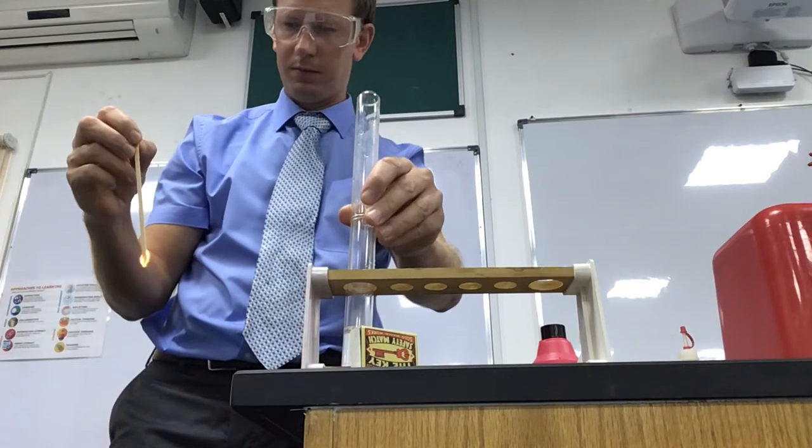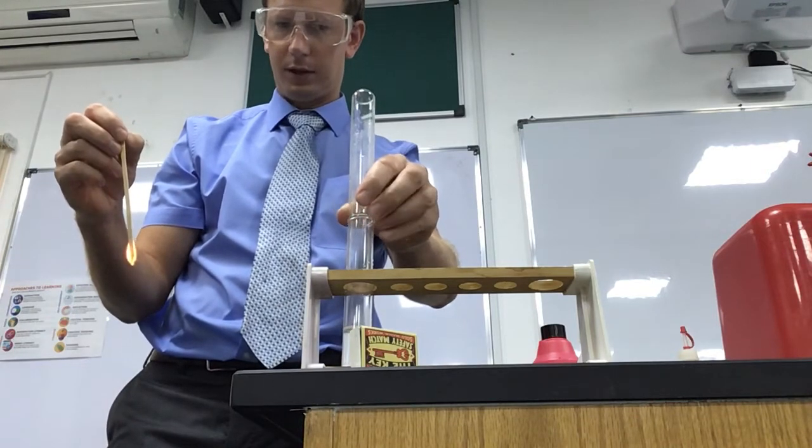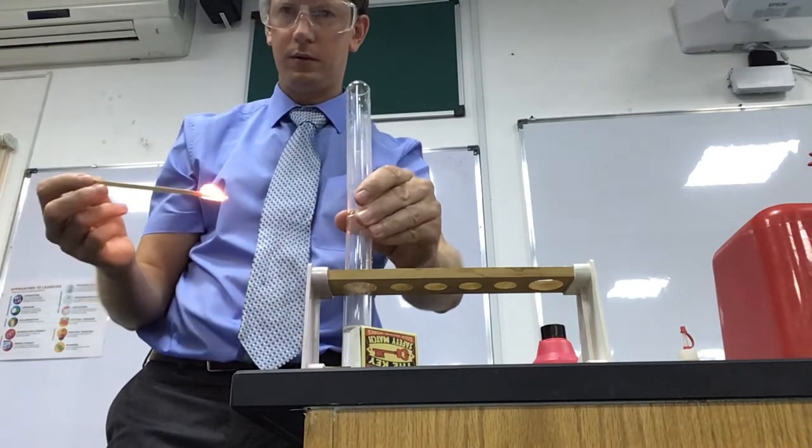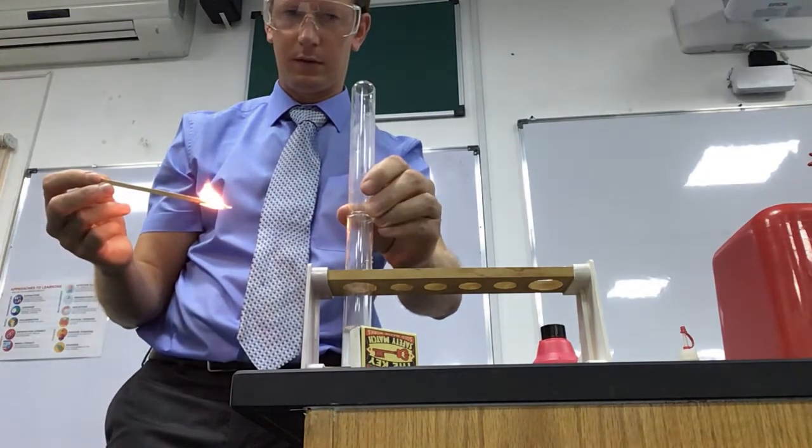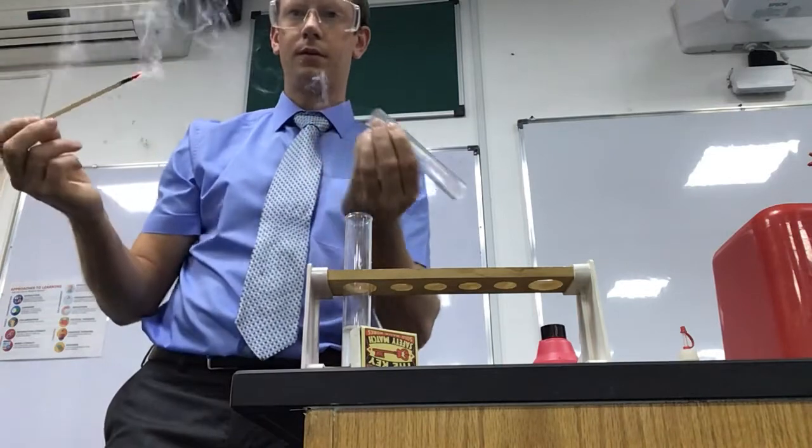We've got a good flame going, so that we light our hydrogen well. Get a good shake, then it'll be a nice pop.